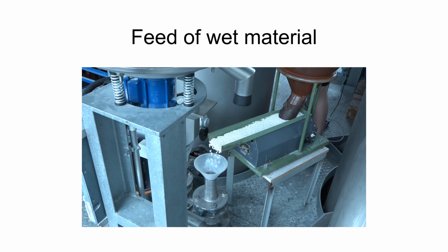Now we show you how we feed continuous or semi-continuous wetted material into the already dried fluidized bed process.